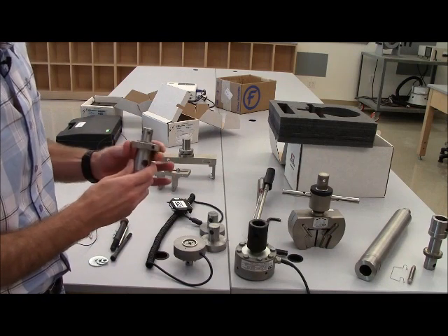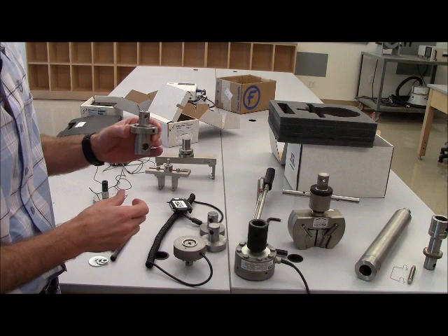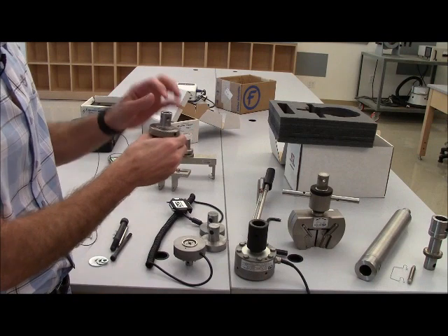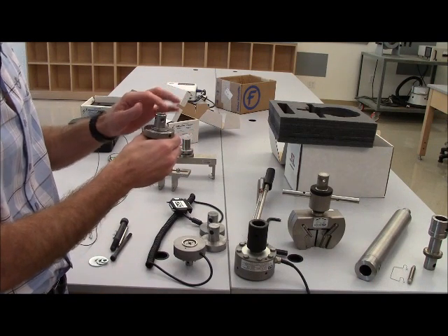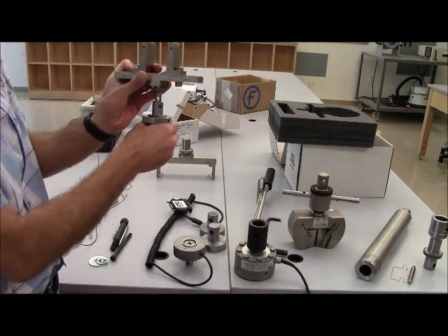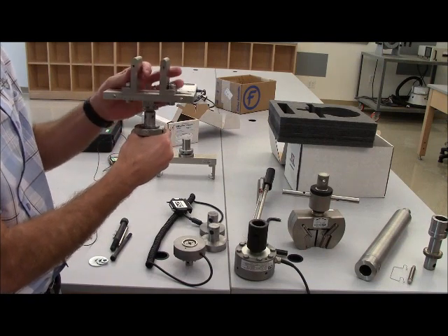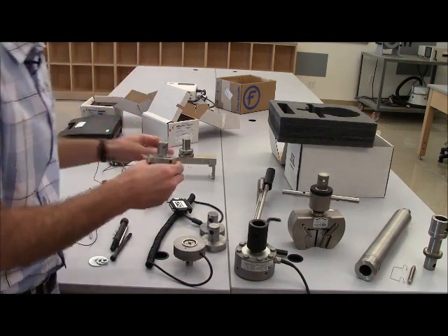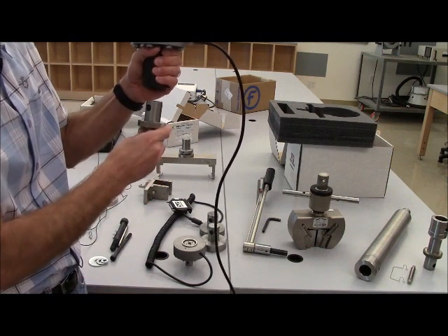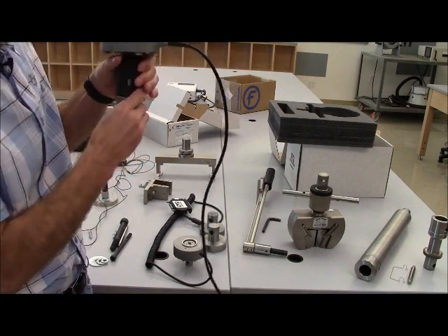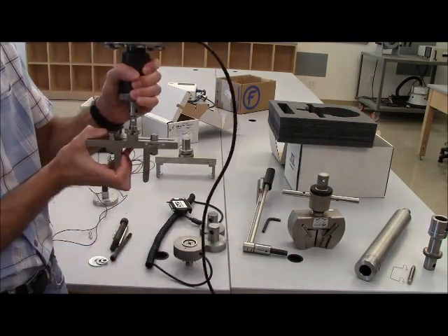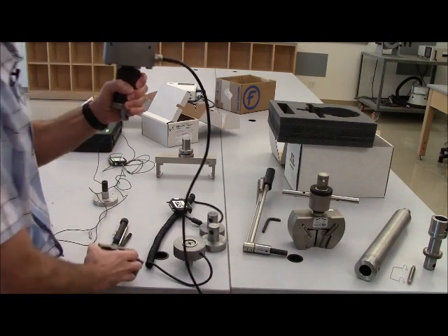I'd like to also point out that there is an adapter that goes from the type DM to the type OM. This is used in the bottom of the machine. So the bottom of the machine has a type DM connection, and so this fits into that. But if there's something that at the bottom of the machine that you wanted to place that had a type OM connection, for example this attachment here, then you would be capable of doing that at the bottom of the machine. You could actually use this also on the top of the machine. For example, if you had a 50,000 newton load cell, the DM connection could be made there. And then if you would like to attach an OM attachment, same thing could be done there. So that adapter will come in handy.